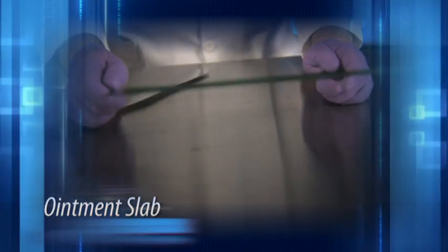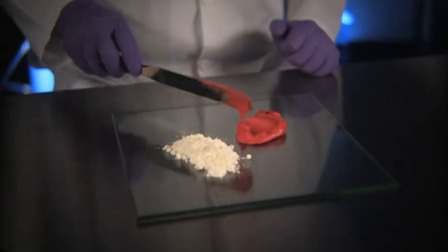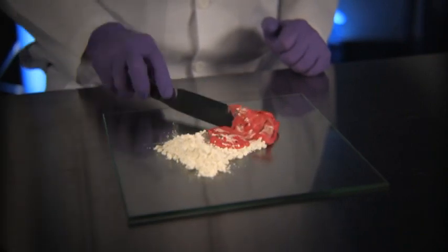Usually made of a 1/4 inch thick piece of glass, ointment slabs are non-porous and are easily cleaned for immediate reuse. In addition, ointment slabs keep the countertops clean and protect them from damage during the compounding process. These features make ointment slabs the preferred surface when compounding. The downside of ointment slabs is that they are easily broken, so be careful.